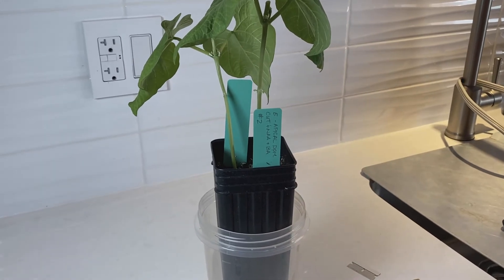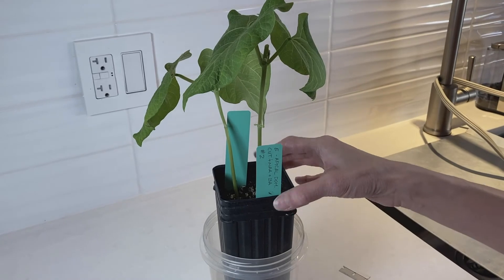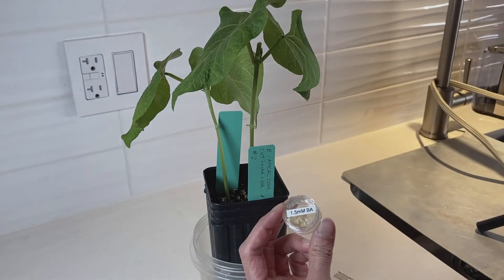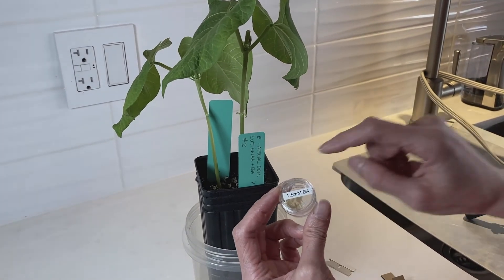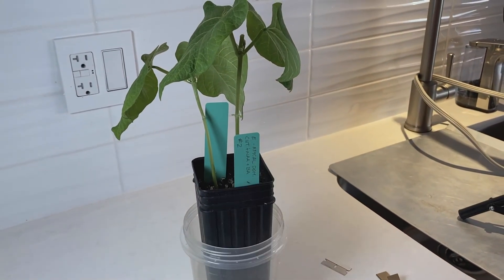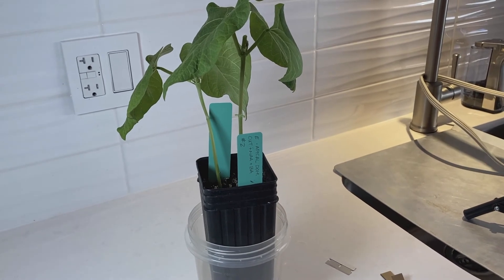That's it and good luck. One more thing I almost forgot: for treatment E only, you want to apply a second application of your BA in lanolin to the lateral buds on the next day. So I applied it today when I started the experiment, and tomorrow I want to do another application of the BA in lanolin with a Q-tip to the lateral buds. Then you just monitor your plants for two weeks, doing about three measurements per week and taking photos to document everything.